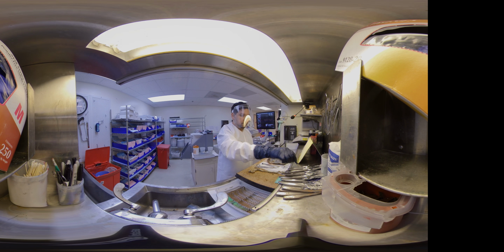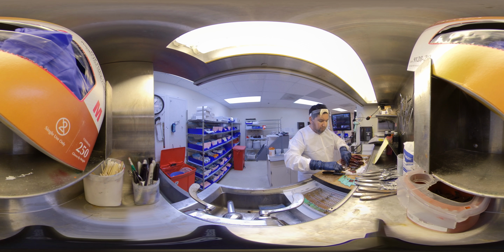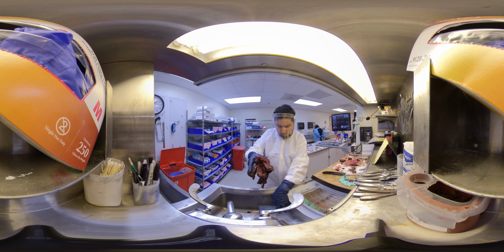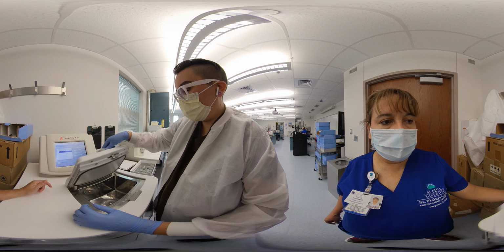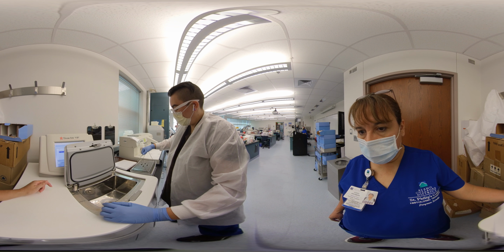Now that the grossing has been completed, the grossing tech takes the representative sections and places them into the green cassettes for further examination. These cassettes will go into the next area in histology, which is processing. The details of what occurs in the tissue processor is beyond the scope of this lesson, but it is good to know that in the tissue processor, water is removed and is replaced by hot paraffin.